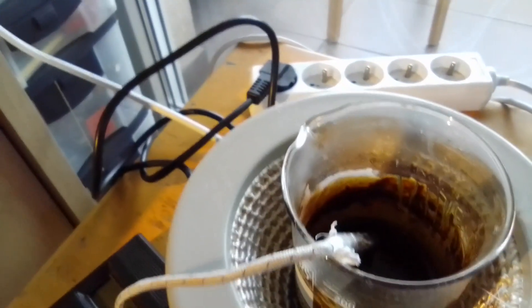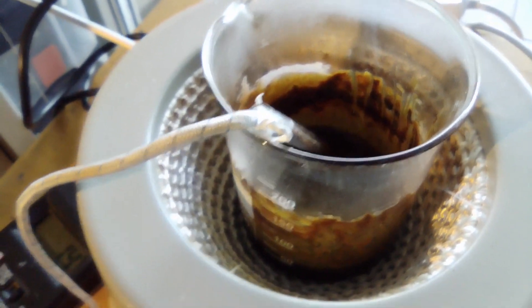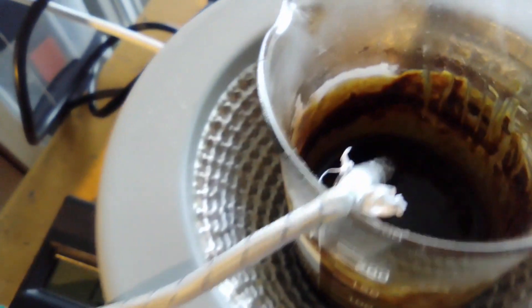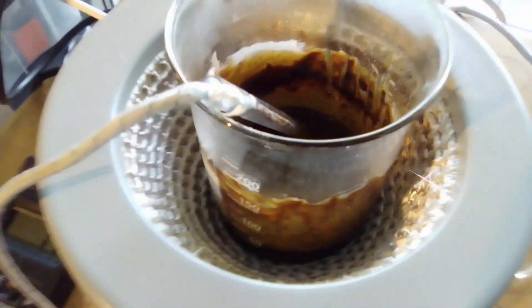After the addition of salicylic acid, I'm now ready for the addition of formaldehyde. I have cooled this to approximately 1 degree Celsius. As you can see it's stirring — barely — it's pretty thick. I have 3.5 milliliters of formaldehyde here and I'm going to add it in with stirring.